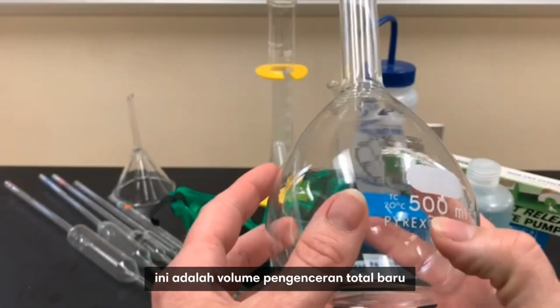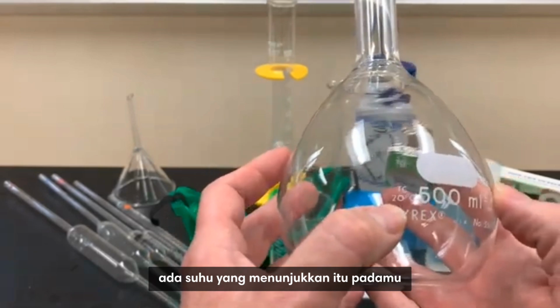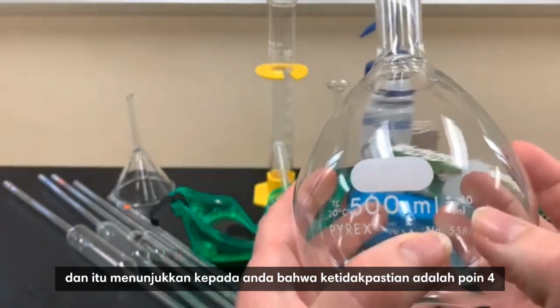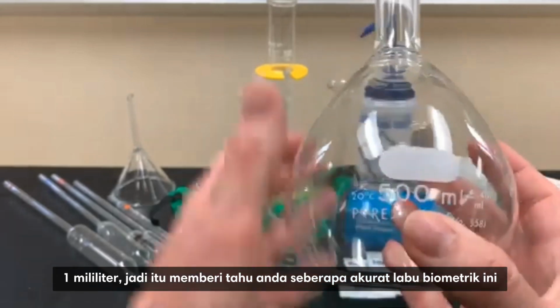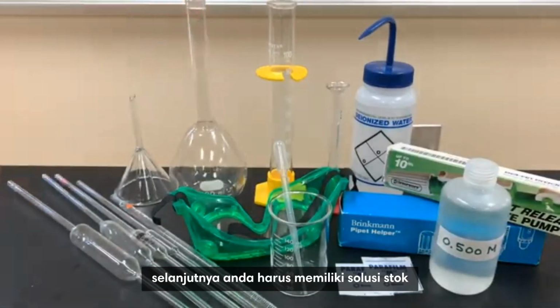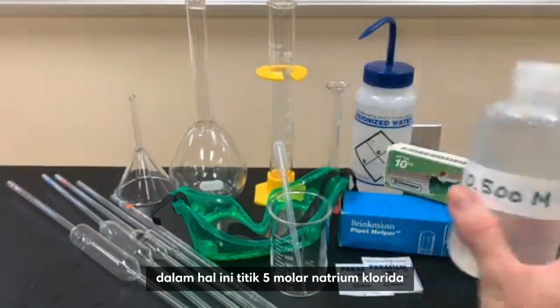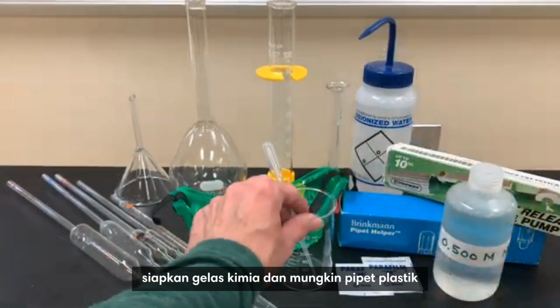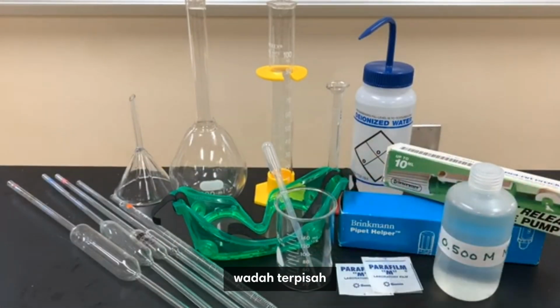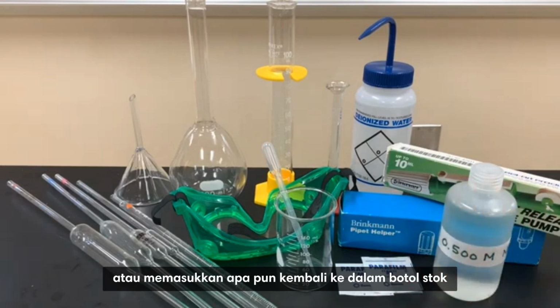This is the new total diluted volume for the problem that I'm going through. There's a temperature that shows you that it's accurate at 20 degrees, and it shows you the uncertainty is 0.41 milliliters. So that tells you how accurate this volumetric flask is. Next, you must have the stock solution that you're going to be measuring and then diluting, in this case the 0.5 molar sodium chloride. Have a beaker ready and maybe a plastic pipette so that you can put that into a specific separate container.